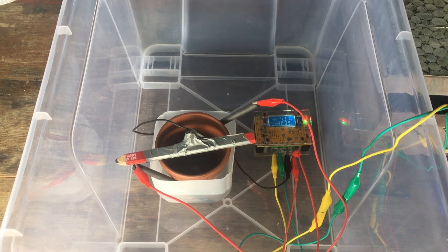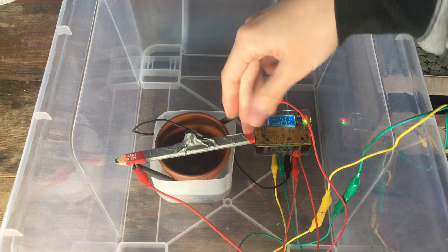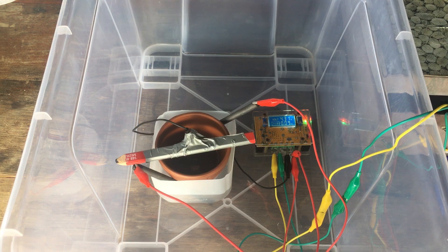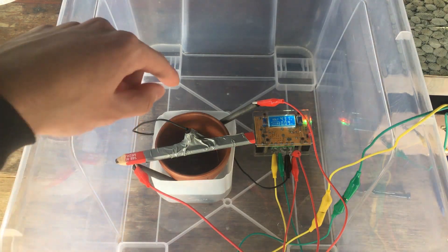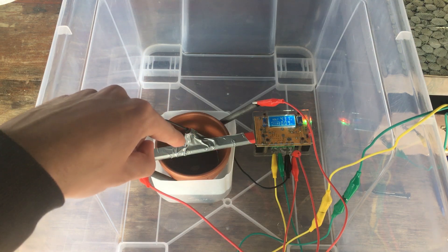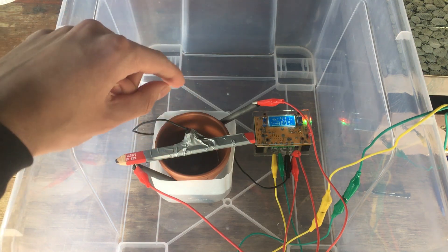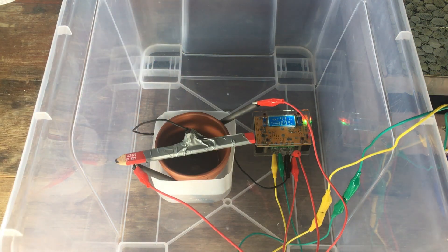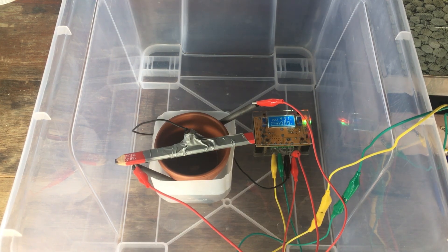It's approximately 90 to 100 milliamps right now. What that should hopefully do is prevent the copious amounts of hydrogen bubbles on the cathode from ruining the manganese surface just by producing them at a lower rate. And then the second thing I did was add a very small amount of sulfuric acid to the cathode compartment, just acidifying it a tiny little bit. This seems to have worked really well in generating a nice smooth coat of manganese. So we'll get a look at that right now.